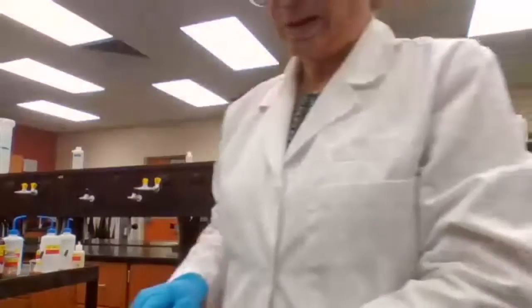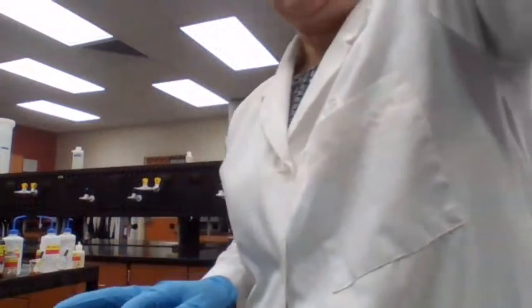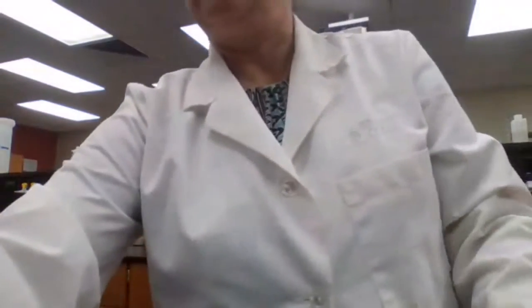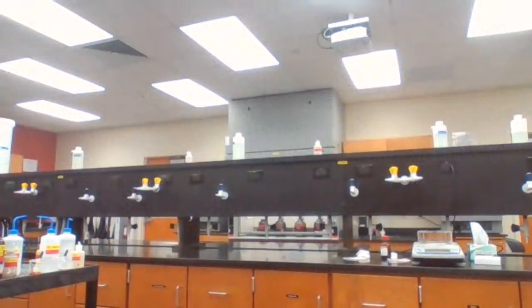My sample is dry enough. I'm going to take the laptop to the instrument room so you can see the procedure for melting.